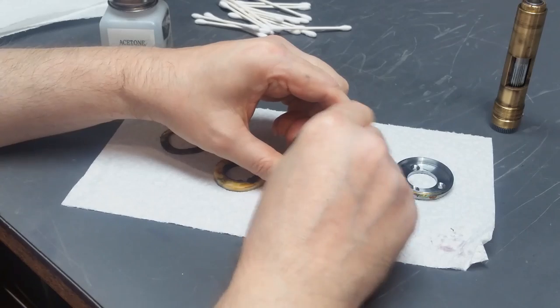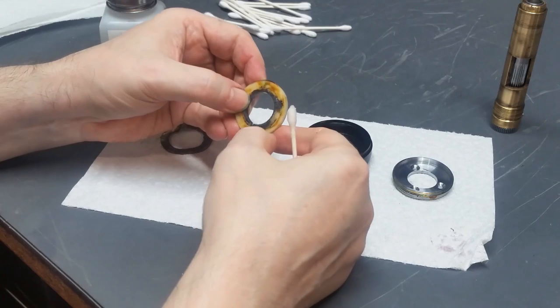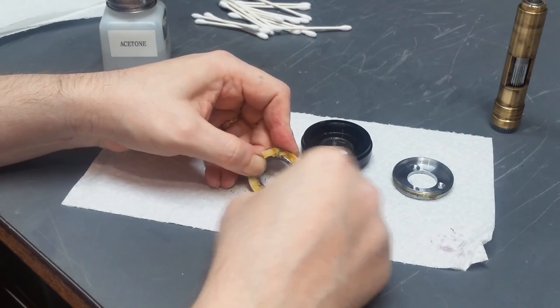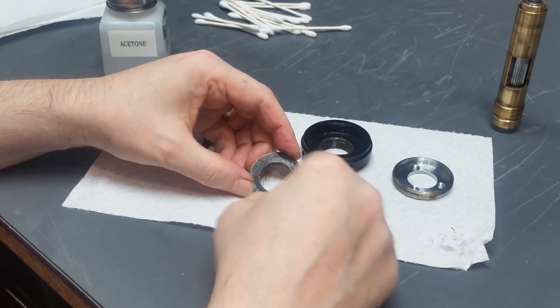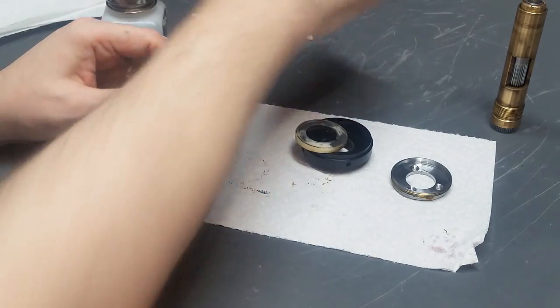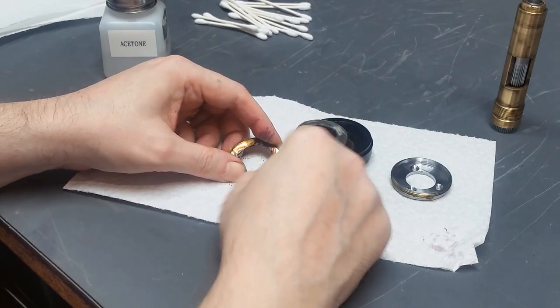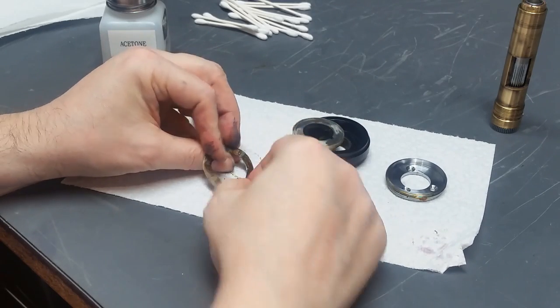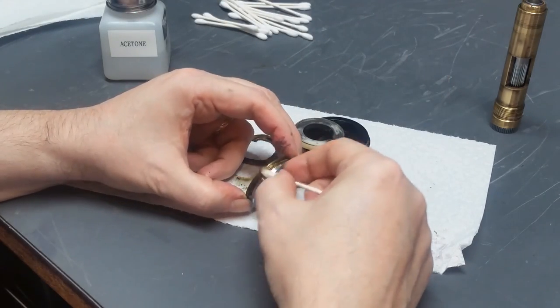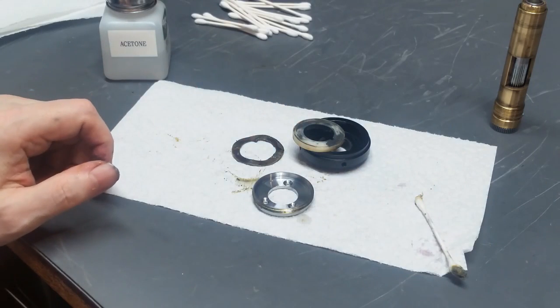So, yeah, I don't plan on making you watch the whole cleanup of these parts. I just want you to get some kind of an appreciation for how bad this grease is. It's solid. It's literally solid. It's not grease anymore. And the same goes for this wave washer. This stuff will clean off. Takes elbow grease, takes soak time. It'll clean off. And the same thing for the grease around here, especially the grease that's in these threads around the perimeter. So I'll be back when it's all clean.